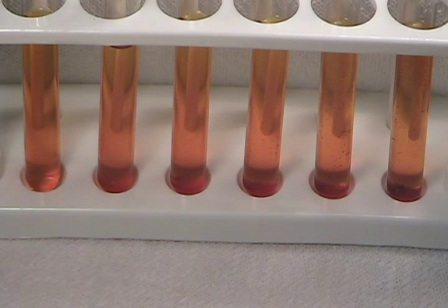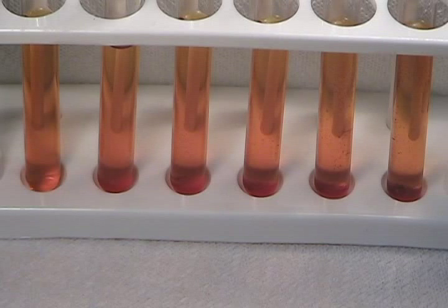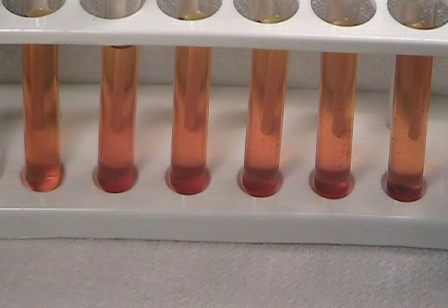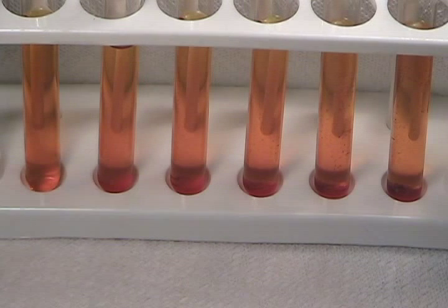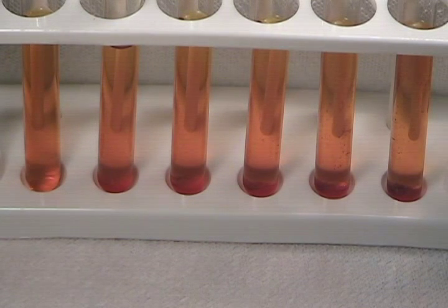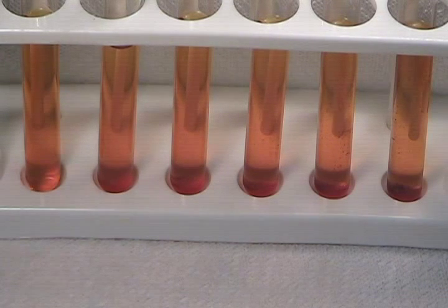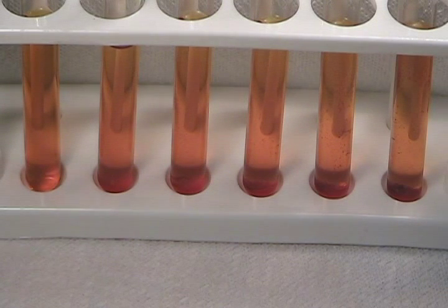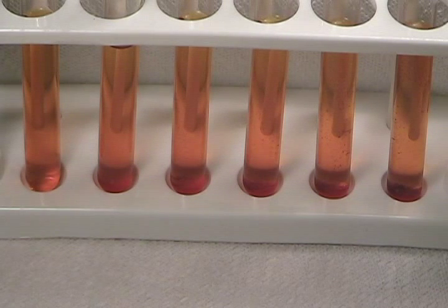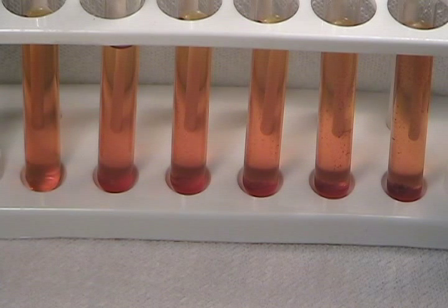I ended up going back and making even smaller dilutions of the quinine solution. What I found is that by allowing the quinine to react with the Dragendorff reagent for a matter of hours to a day or two, I could get down to positive results at the sub-one part per million level — in other words, the parts per billion level. So Dragendorff is indeed a very effective reagent for determining the presence of alkaloids, or at least quinine.